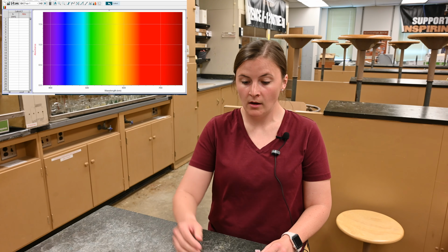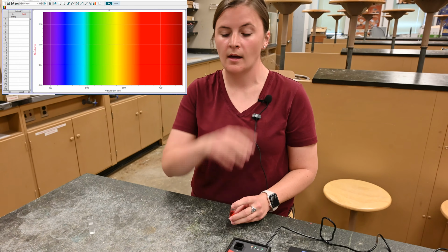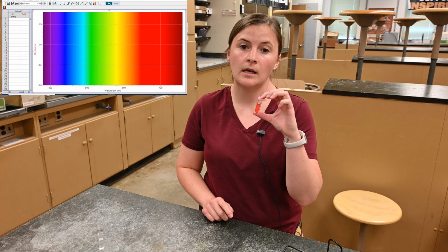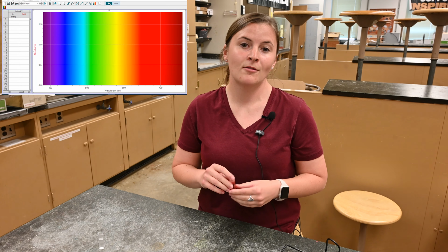So we have red solutions. I have cherry Kool-Aid here, and so we're going to expect to see peaks in the blue region of our graph, because when a substance is a certain color, it absorbs its opposite color, if you think about your primary color wheel. One of the main ingredients in our Kool-Aid today is a red food dye. It's called Red 40, and I actually have a sample of this for us to get a baseline to see where our absorption spectra fall.